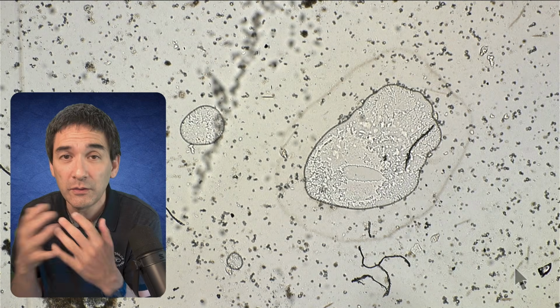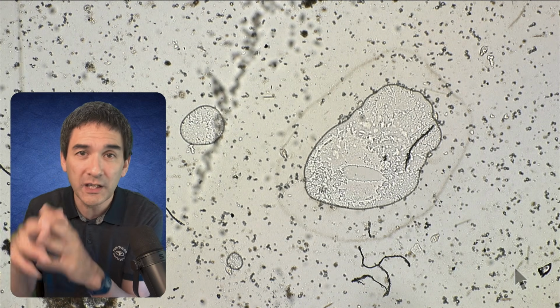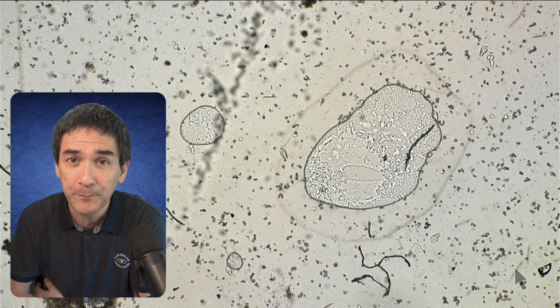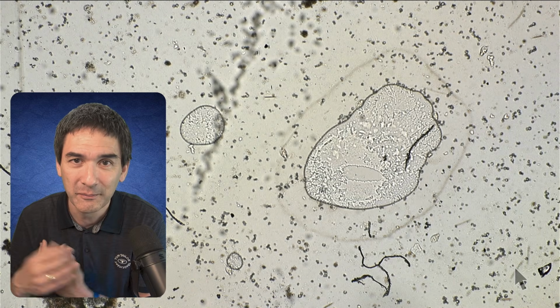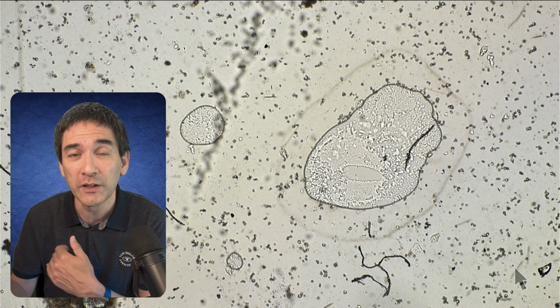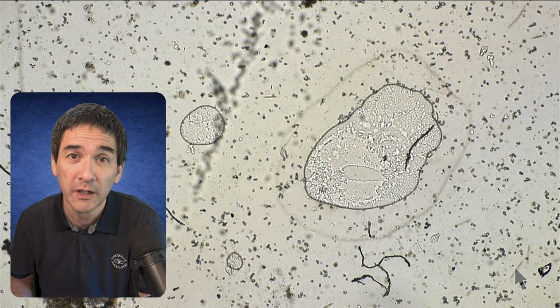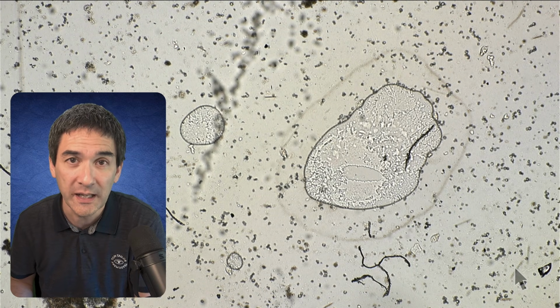Very often, when you do this yourself at home, you will find those aerotactic bands not around bubbles, but towards the edge of the cover glass, because this is obviously where it touches the air. Very often you can also see that those aerotactic bands will start to move towards or away from the edge of the cover glass.